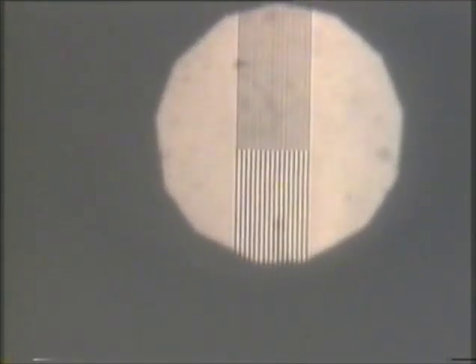So what I'm going to do is simply now show you the back focal plane and begin to move the camera, the one showing you the back focal plane. You see that the diffracted beams and the zero order, they're going out of focus, they're spreading, they're getting larger, they're coming together, they're beginning to overlap, and you can see in the middle the image is just beginning to come as they overlap. And when we get to the correct distance, when we get the thing into focus, there you see an image of the object.